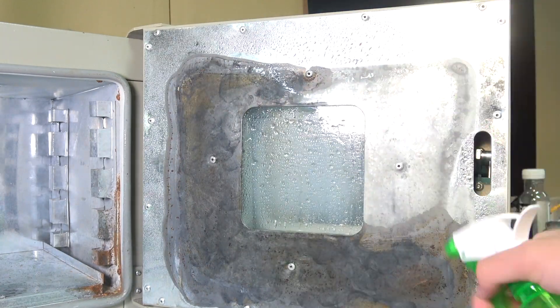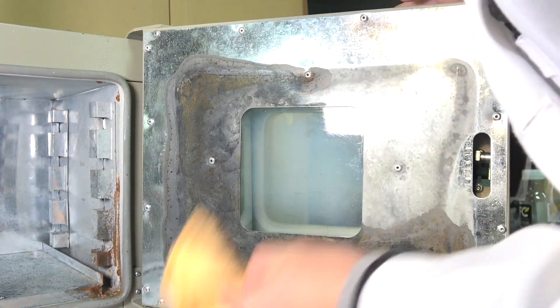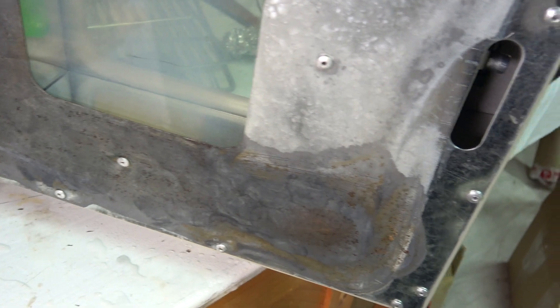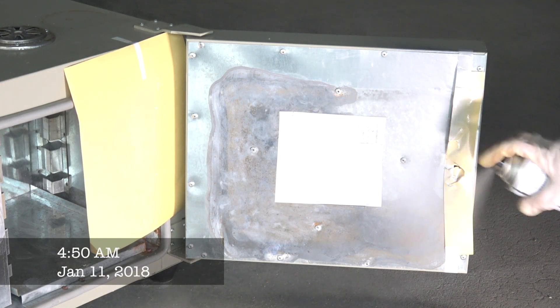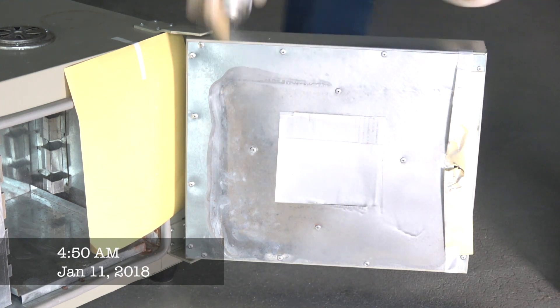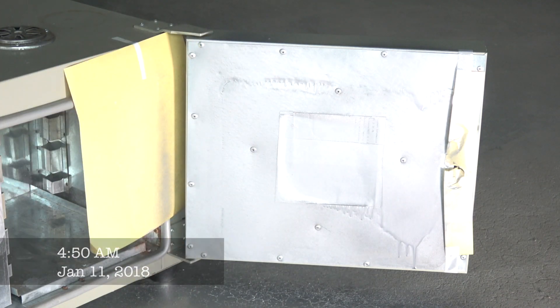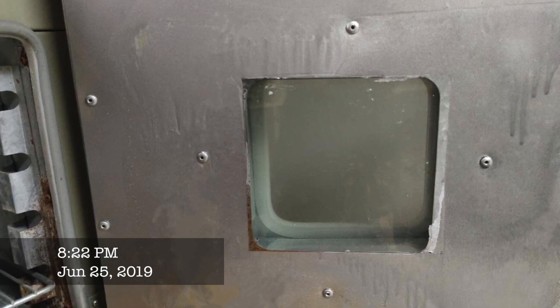Just like before, I cleaned the surface with a copious amount of distilled water and thoroughly dried it. At this point I can leave it as is, but since it's going to show up in a lot of my future videos I decided to go a little further for cosmetic purposes. Since I did this project a while back, I'm able to show you how well it has held up for the year and a half of torment I continue putting it through.